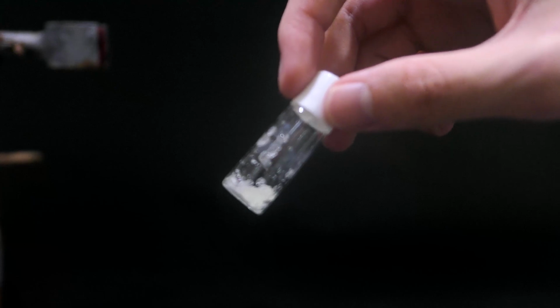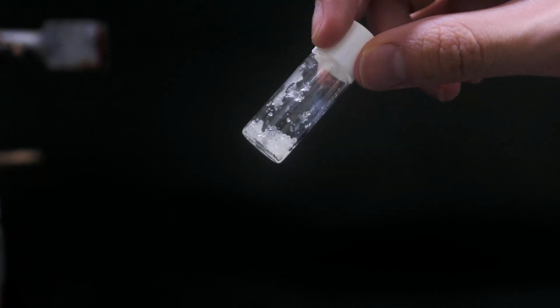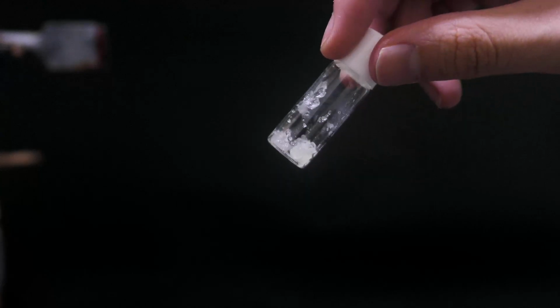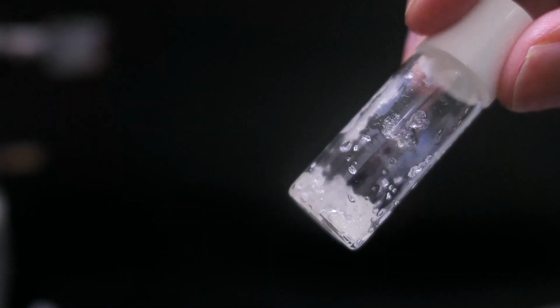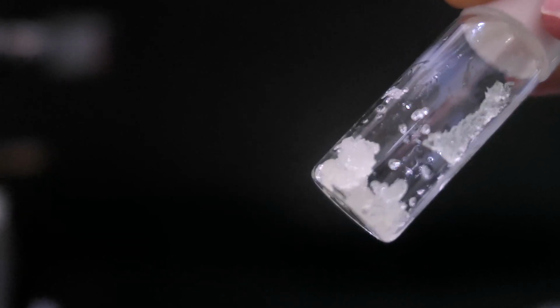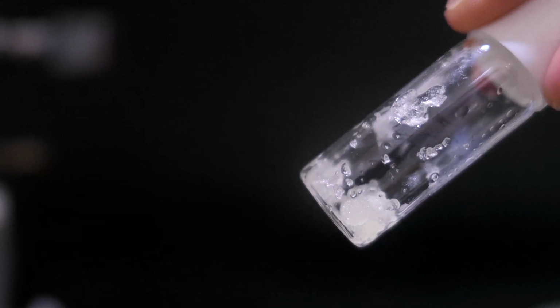Because this substance is highly hygroscopic, it is transferred into a glass vial immediately. Probably the crystal can be dried in a sulfuric acid desiccator, but I just don't bother since I'm just making it for fun. The final yield is terrible, only 2.1%. I suspect that due to the extremely high solubility of chloroantimonic acid, a lot of product remains in the solution. Maybe harvesting another crop of crystals is possible by reconcentrating the solution, but it's just too time consuming.